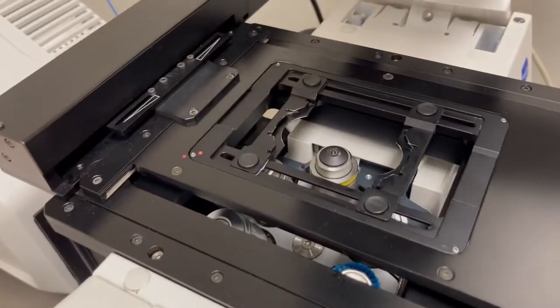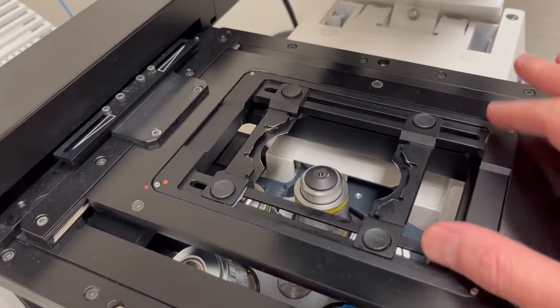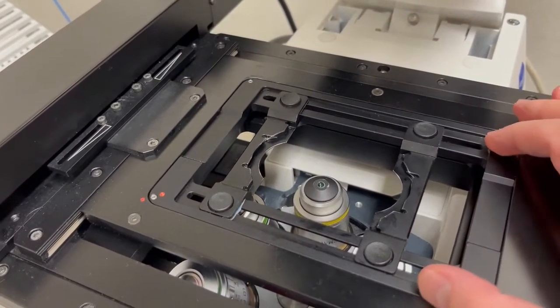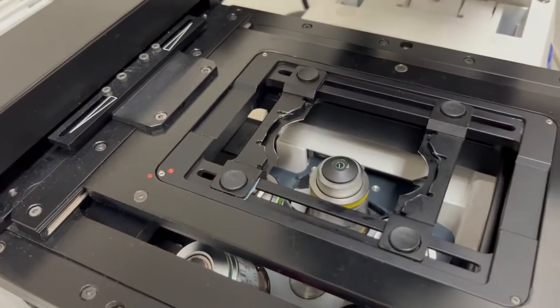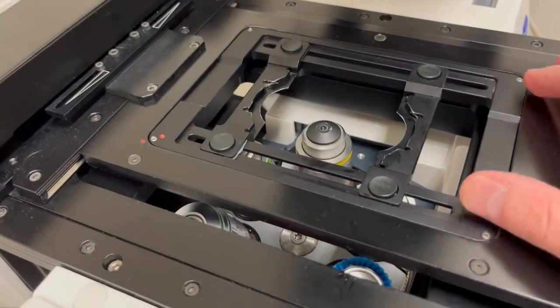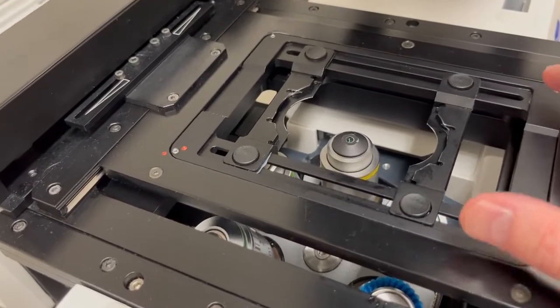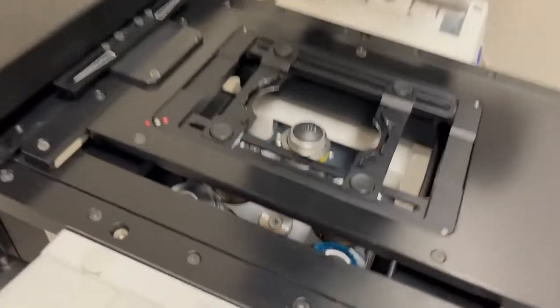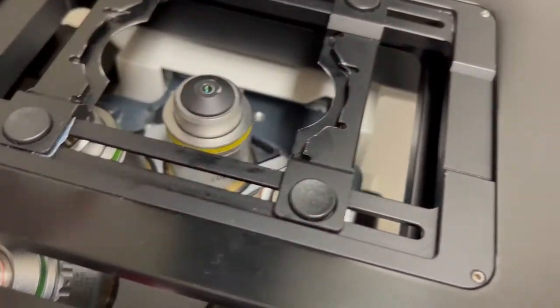The reason I recommend you do this is the 10x is one of our shorter objectives, and so this gives us room to check whether this is in the proper position, lowering the risks of banging this into an expensive piece of metal and glass. So what you want to do is check that this is level and that it's not moving and that it's clean. So you want to check these rims here, which is where your sample is going to go.